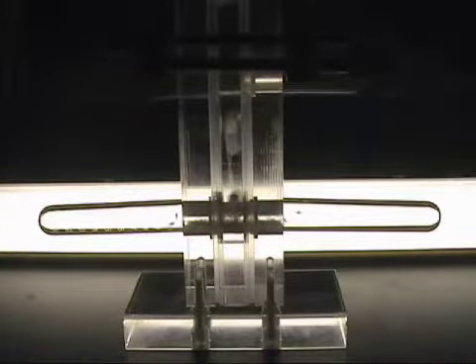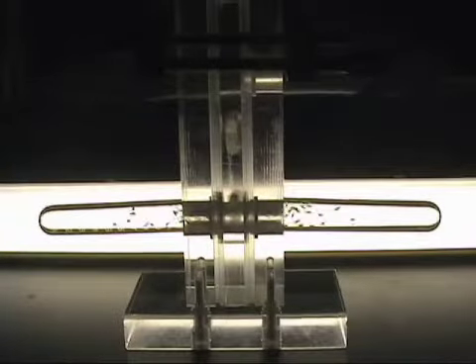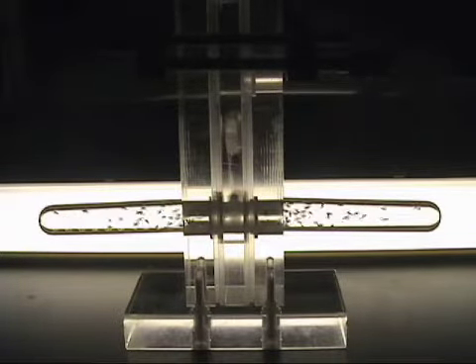In the control trial, both arms of the maze contain fresh air. As we observe, the flies show no significant preference as to which arm they enter.